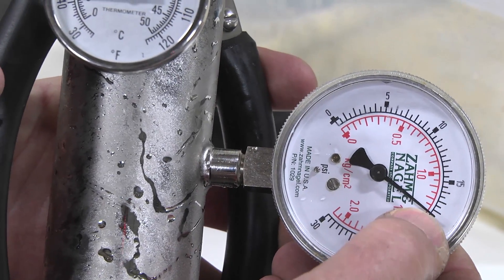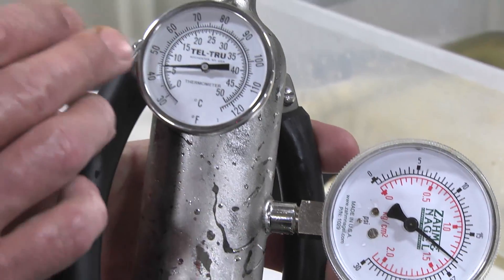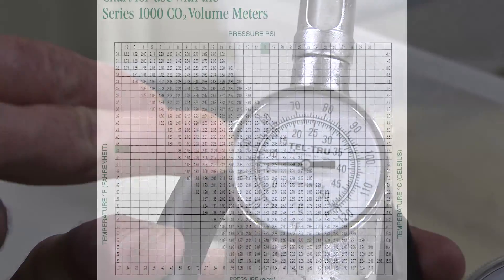Equilibrium is achieved when after shaking, the temperature and pressure remain constant. Record the readings.